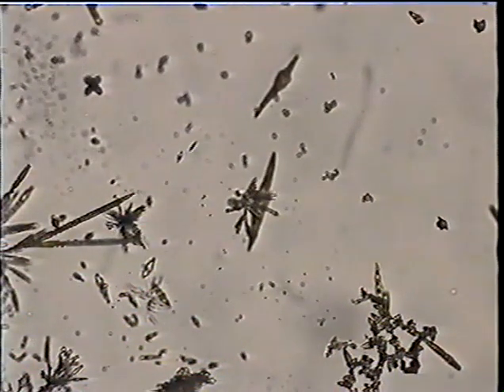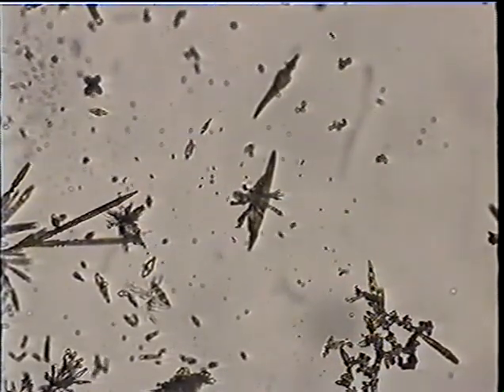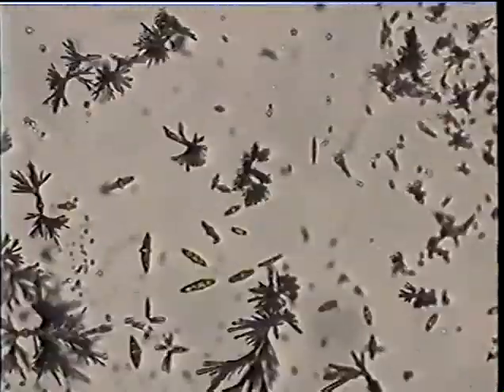There's two of them, big ones. There will be a number of smaller ones. There's some in the lower left corner now. And here's some in the upper right. And there we are again. They will thicken in the middle and become sort of diamond-shaped before they're through.